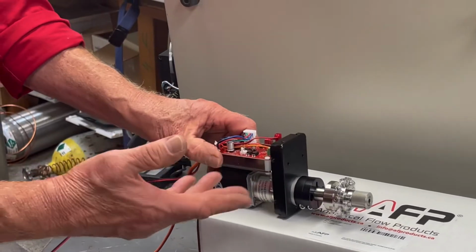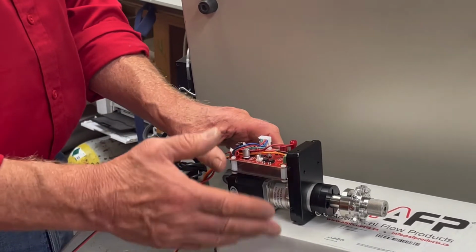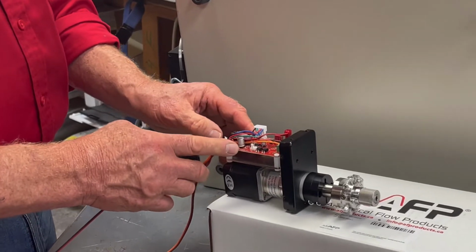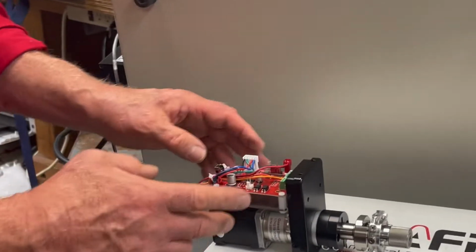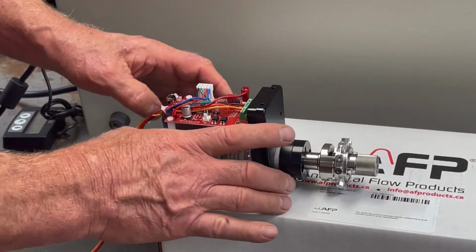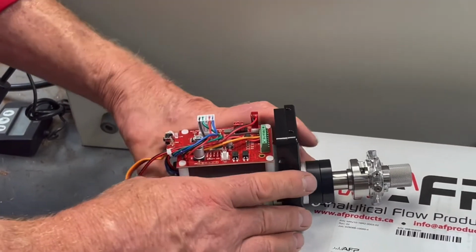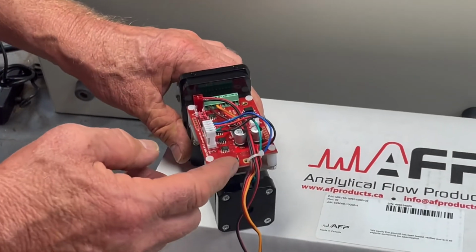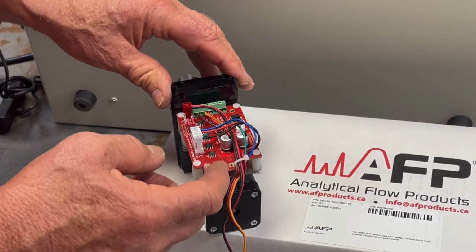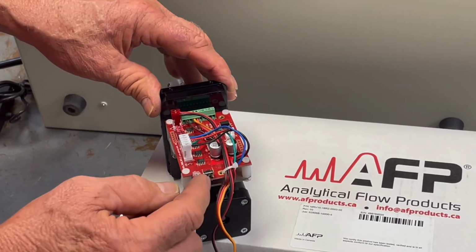The older motors were different. They only did one thing, but these can be told to do a million things. So there's a circuit board here that controls all that. And sometimes, just like a computer, it malfunctions. It's very rare, but it does happen. There's a way to reset the computer logic. If the computer gets confused somehow, then you can reset everything with this little button.